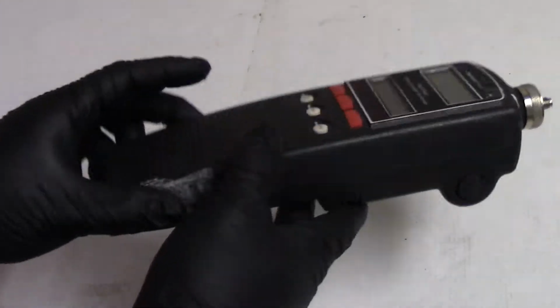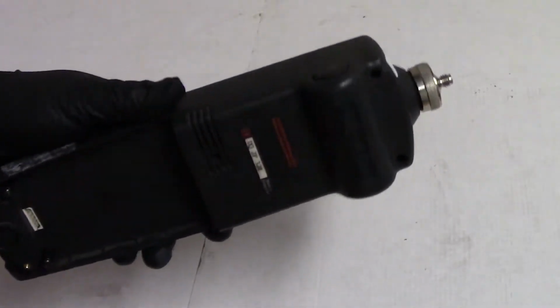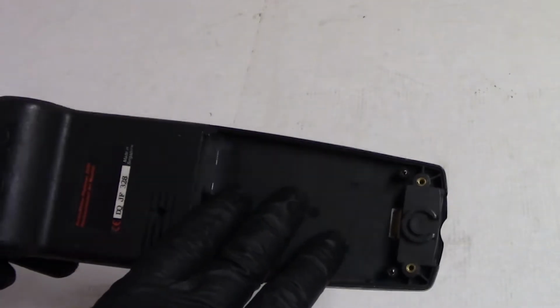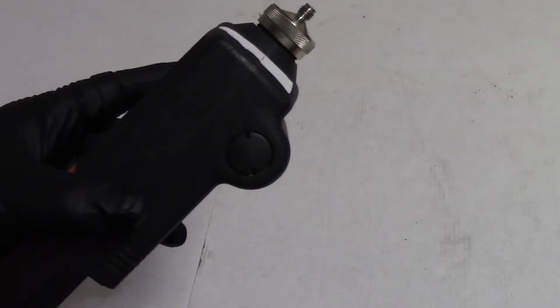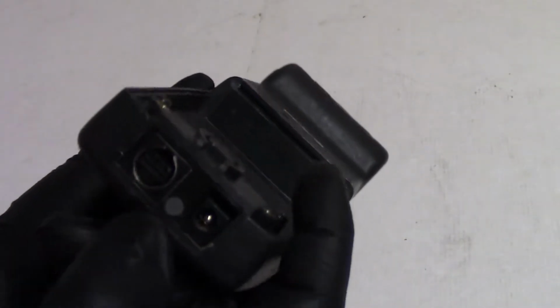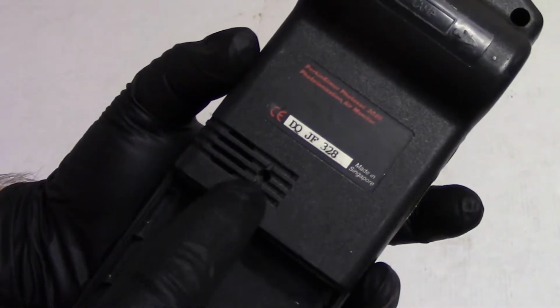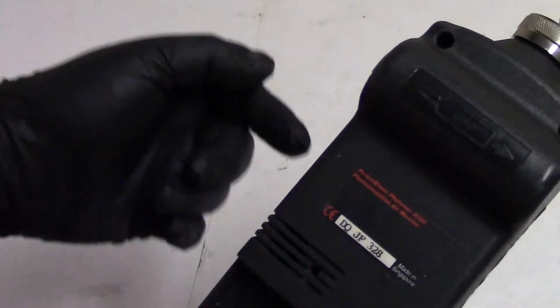So let's just do a little external tour before we open it up. I showed you the filter behind the front cap. Normally there would be a NiCad battery pack in here. I think it's 7.2 volt. That would plug in here, and then there's a battery cover that goes over it. Then you have your charger port for the battery pack, or to run it, I guess that would work. There's a charge LED here. There is a speaker behind here, and then that's the air exhaust, so that when the air is pulled in and run through the sensor, it exhausts through there.